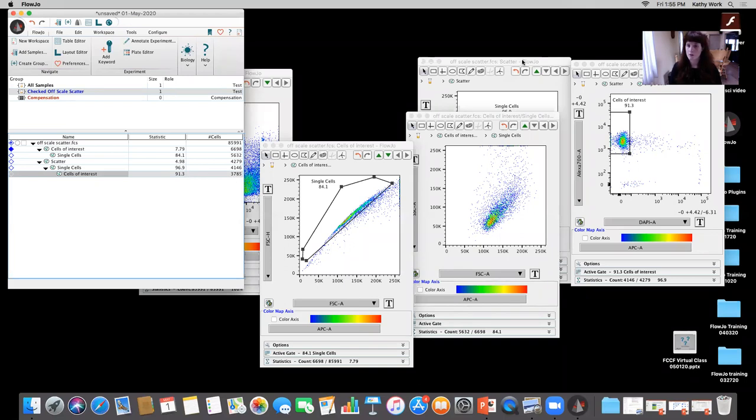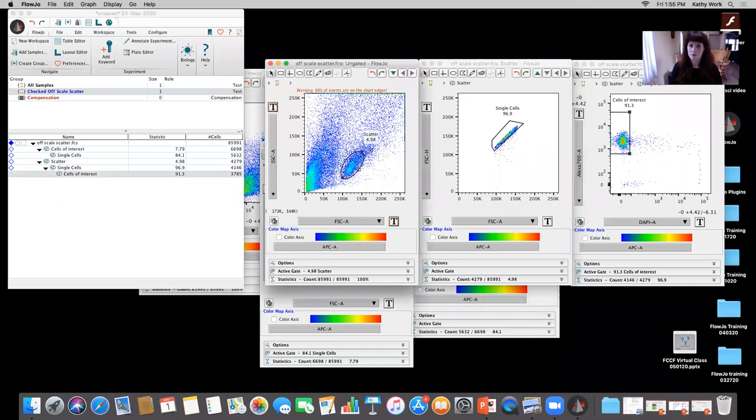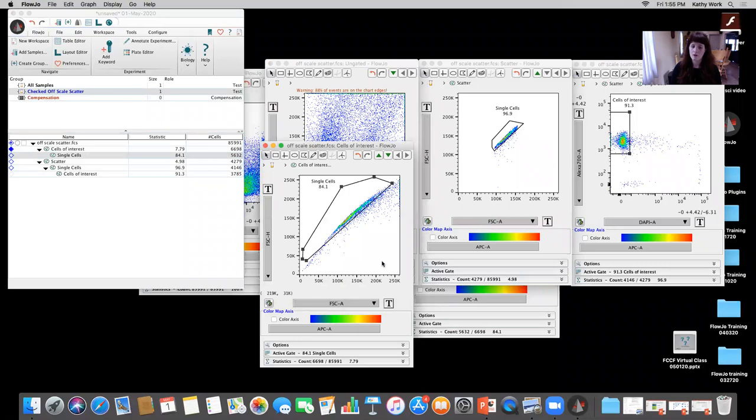If we start off with the scatter gating, just like that, assuming that those are all of our cells right there, which is just what they did, and then single cells and our cells of interest based on fluorescence, versus 5,632 if we did fluorescence first and then looked at our singlets and then verified that there was no debris there. So it's going to be very critical to make sure that we are setting our voltages correctly for scatter, for fluorescence, for all of that.